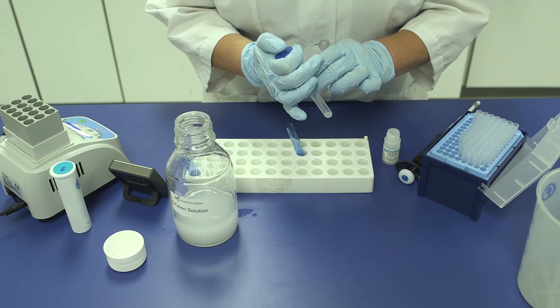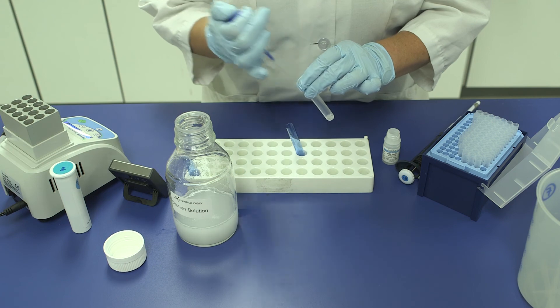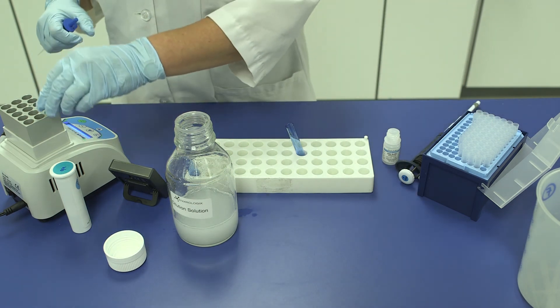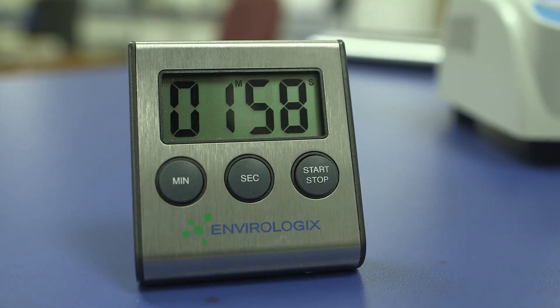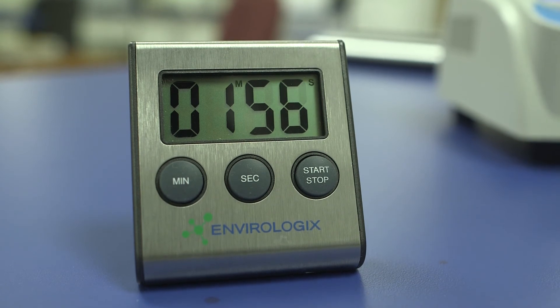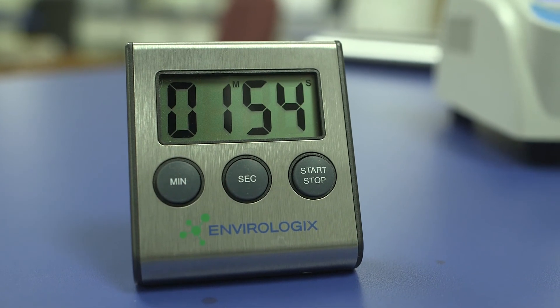Step 3. Acclimate for 2 minutes in the incubator. The acclimation step is only required if room temperature is outside 20 to 24 degrees Celsius or 68 to 75 degrees Fahrenheit.